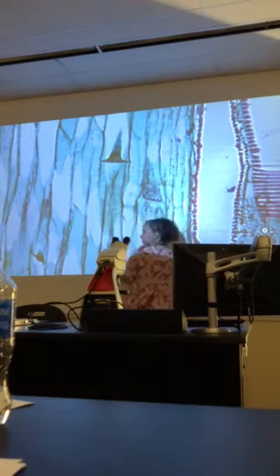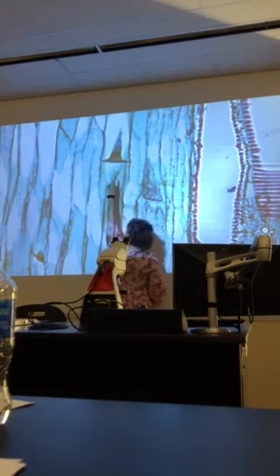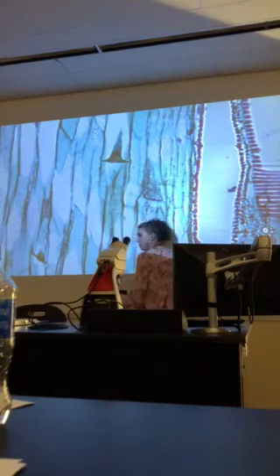These are my sieve tube members. You can see that porous part that actually makes it the sieve tube members, because remember, that's actually got lots of tiny little holes in there. That's my phloem, correct? What does phloem transport? Sugars. Phloem transports sugars. Isn't that the cucurbita? That is actually squash. It is cucurbita, yes.